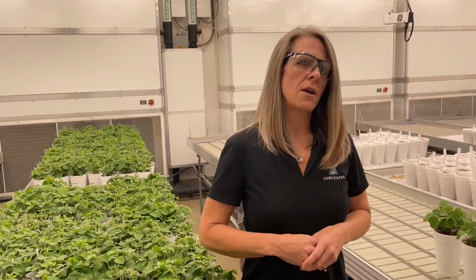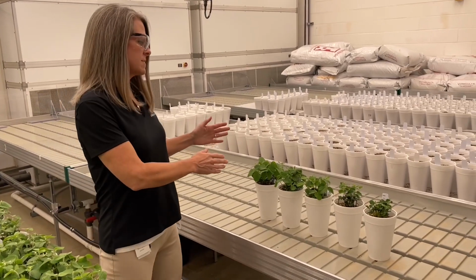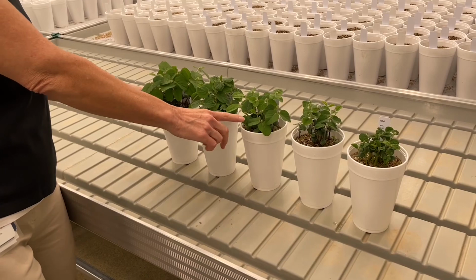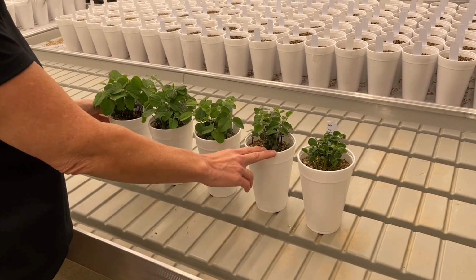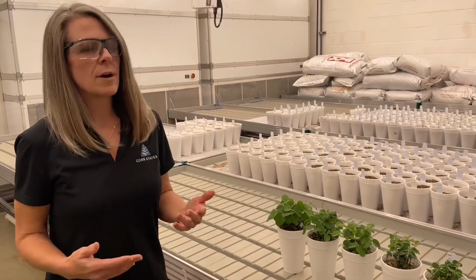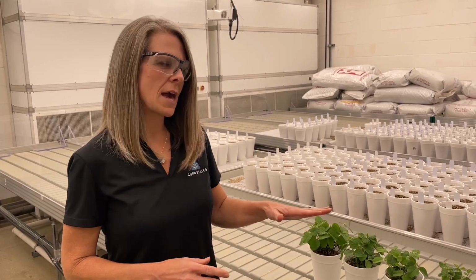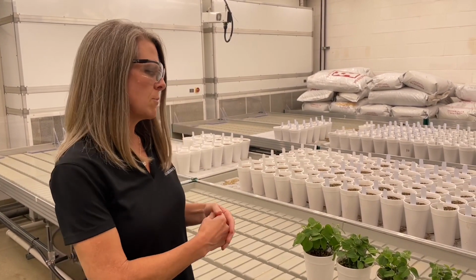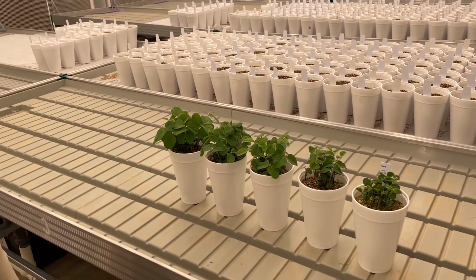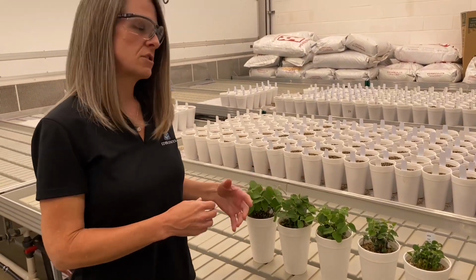So if you look over here, I have an array of the checks that we will use in each test. These checks range from resistant, moderately resistant, moderately susceptible, to susceptible, and these will be present in each of our tests. Now, unfortunately, this test isn't prepared to where I can dump them out and show you the roots yet. We've got about another week to go, but already we can see here the varying responses that we can have to this pathogen. As those roots are rotting and struggling against that pathogen, the plants just don't grow as well.